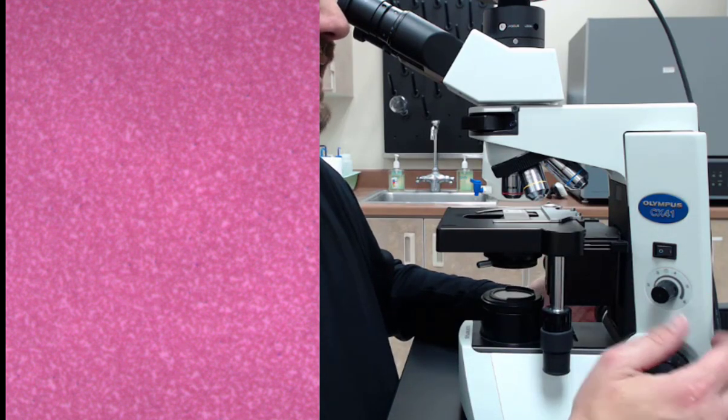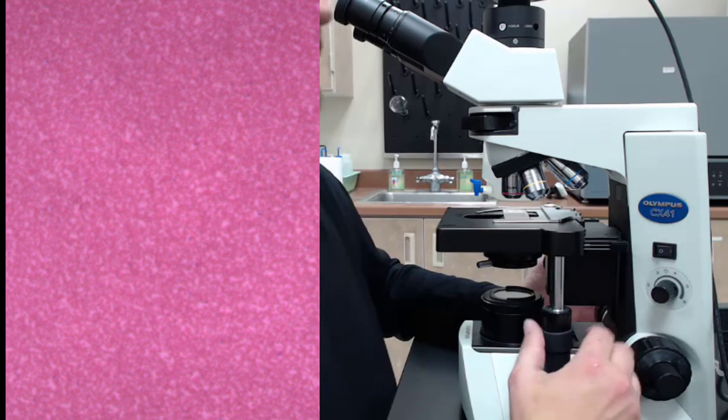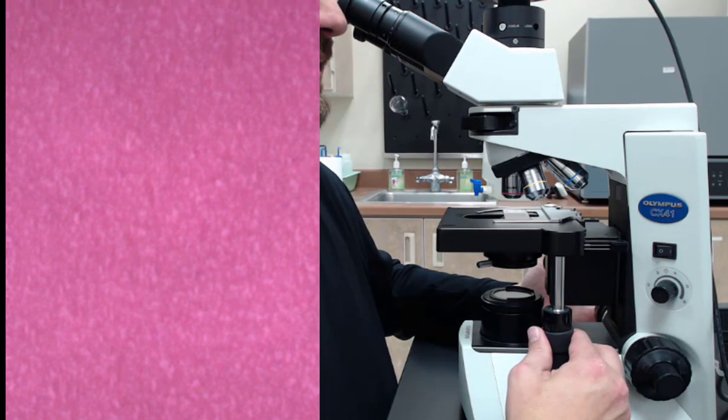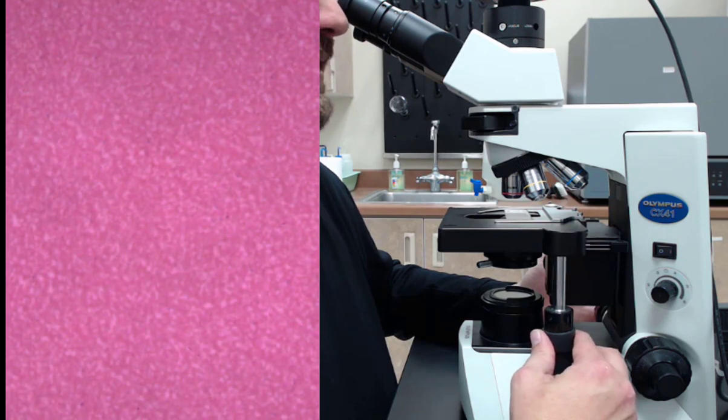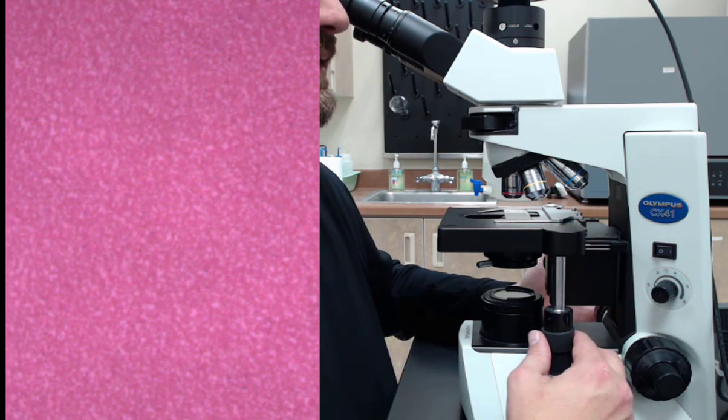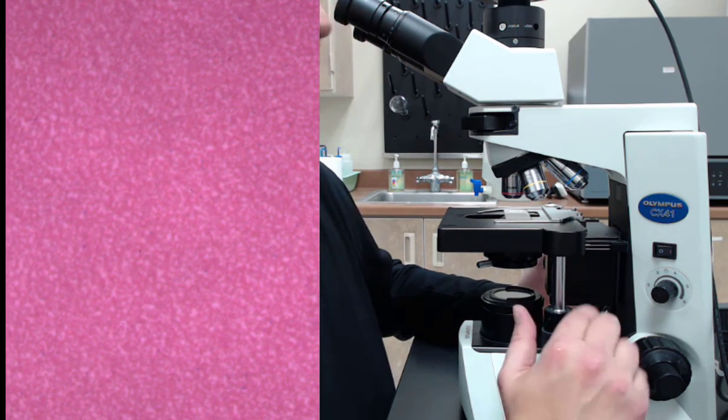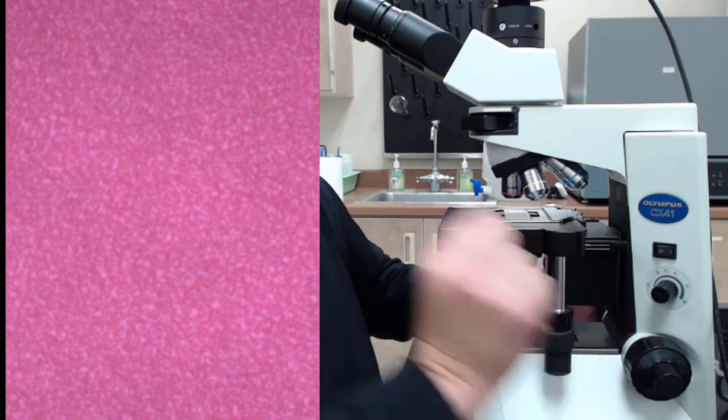Okay, so once I think I have it in focus, the next thing to do before you move on is to find what you want to look at, which really we're just looking at a sea of red blood cells at this point. But you want to find a part of the slide that you think is interesting, not much to look at here. But if you find something you definitely want to see, you want to center it.